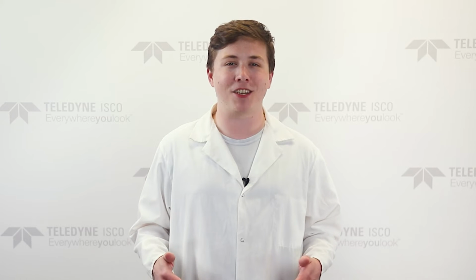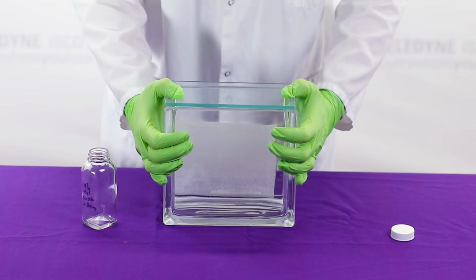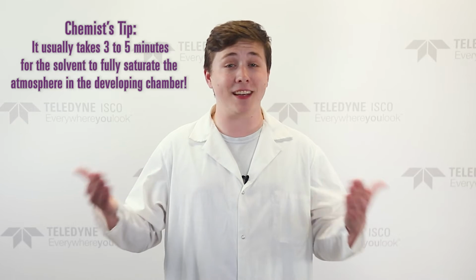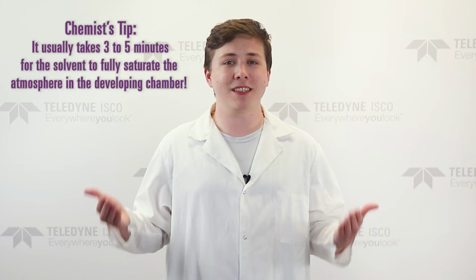Place the developing chamber back down and allow time for equilibration. You can briefly remove the lid to release pressure, but make sure to quickly cover the chamber afterwards. Equilibration should take about 3 to 5 minutes, or roughly the time it takes to prepare the TLC plate. So, while the solvent saturates inside the developing chamber, take your pencil, your straight edge, and your glass plate.